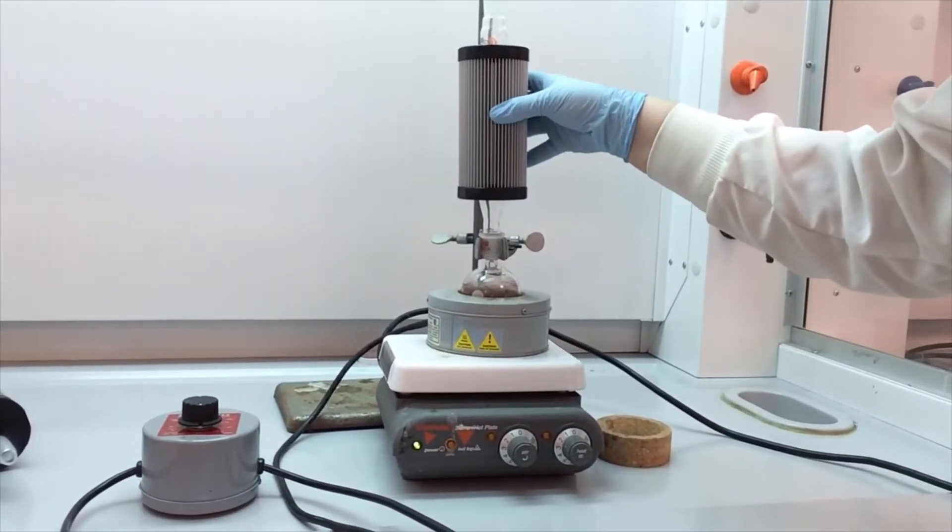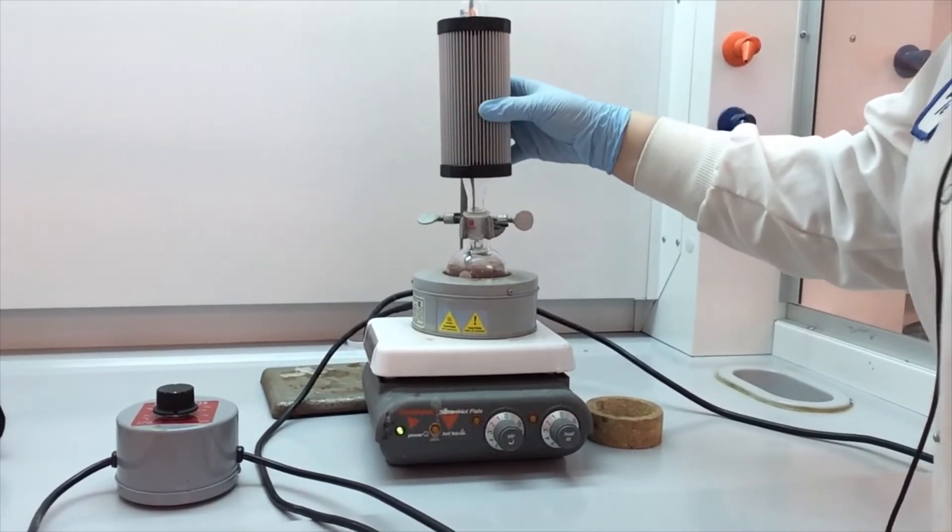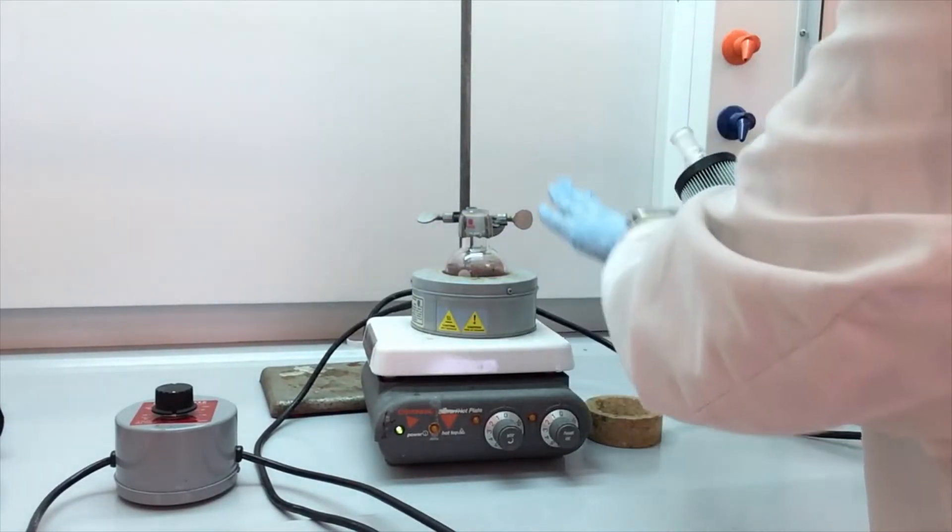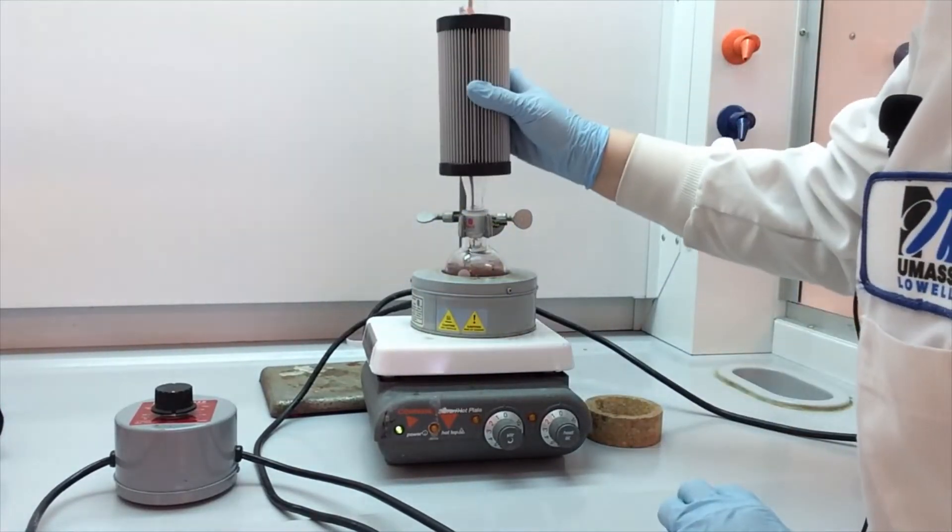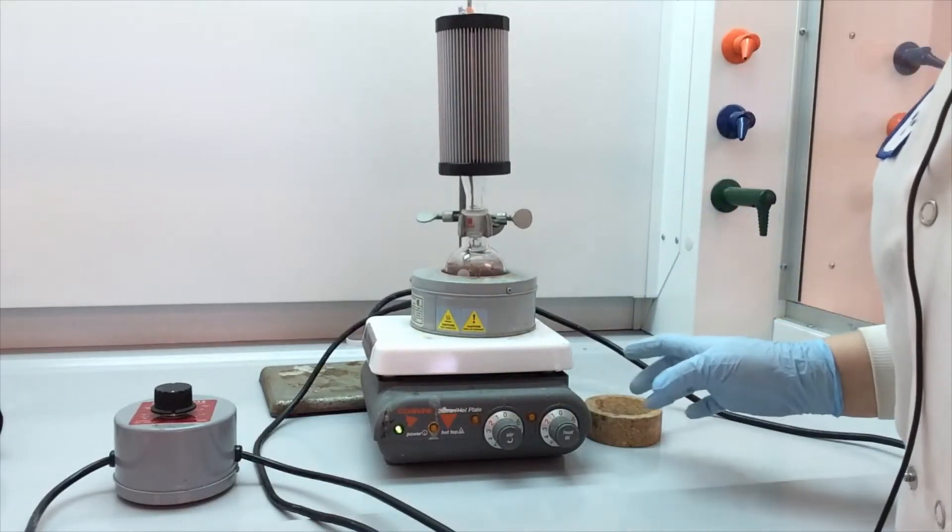If this feels wobbly, something is not right. And you will want to take this off, readjust if necessary. So we are almost ready to start heating.